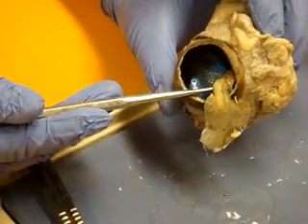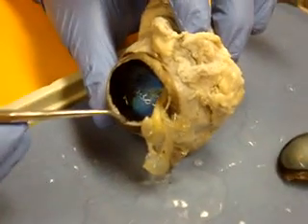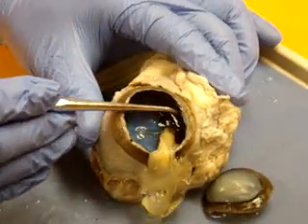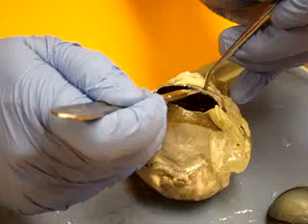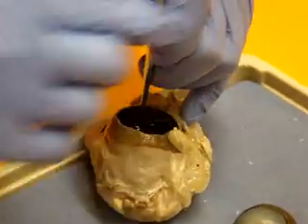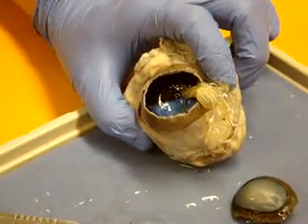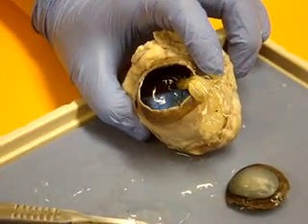So here's the retinal layer, which is the neural tunic in the posterior chamber. This white layer is your sclera, part of the fibrous tunic. That layer I'm separating out is your choroid, which is part of your vascular tunic. Notice that shiny, pretty area in that part of the choroid — that's the tapetum lucidum. You don't have to know that; only animals have it, but that's why when you see them at night, their eyes glow at you.